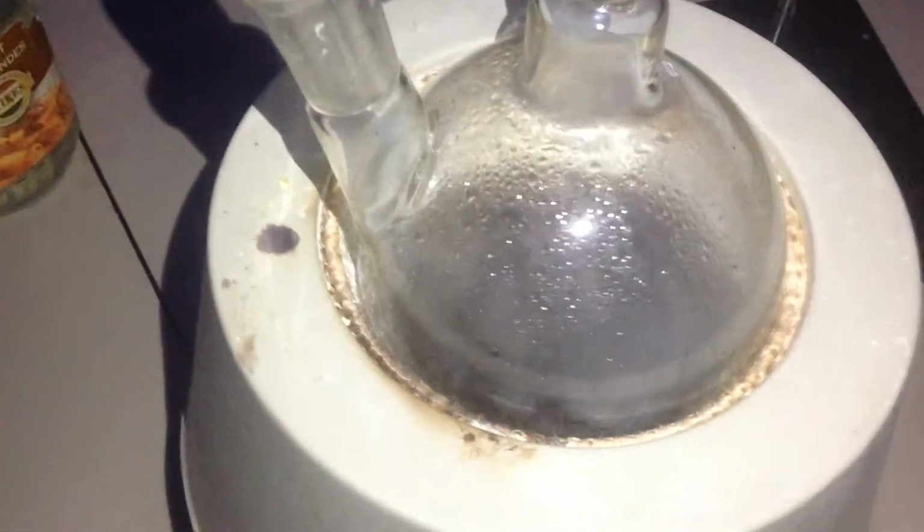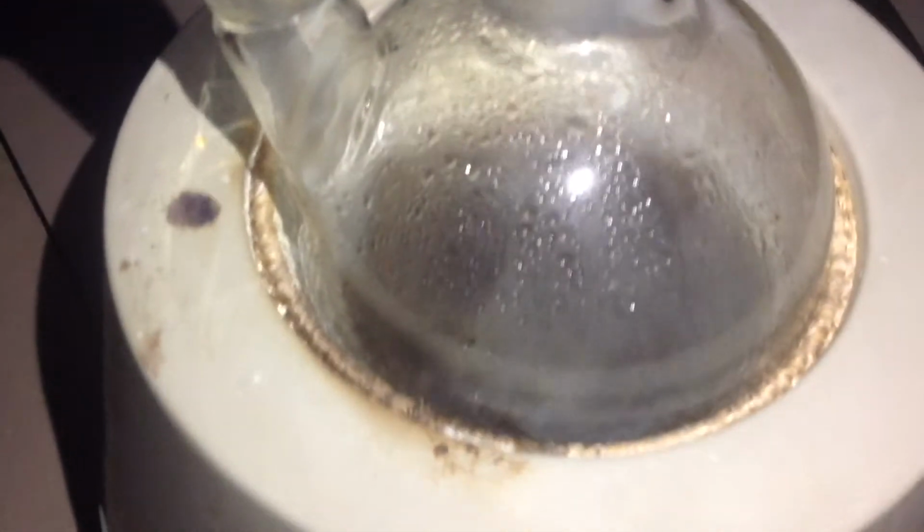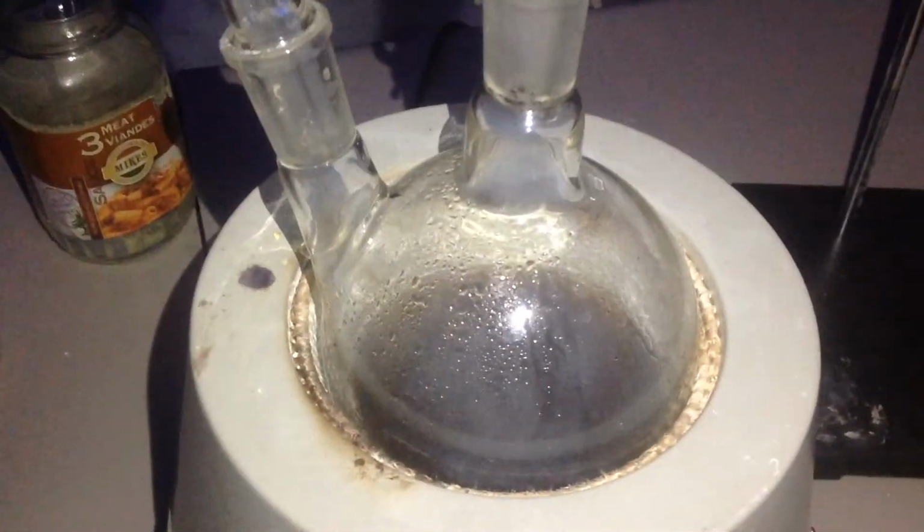Distillation is finally finished. You know when it's finished when it starts making these weird fumes. That's the sulfuric acid getting dehydrated. So that's your end point. And over here we have a bunch of distillate. You may notice it's a bit discolored. That's because it kept frothing over. And because it kept frothing over, I actually had to make this into 3 different batches. So that's why it's a bit darker.